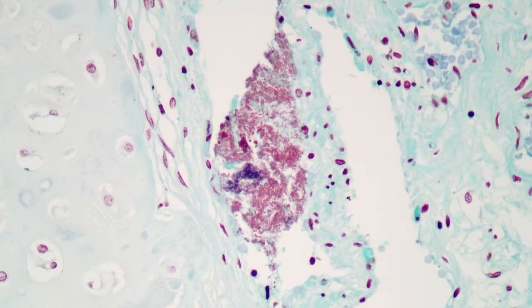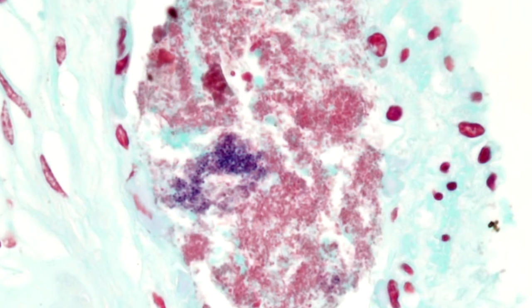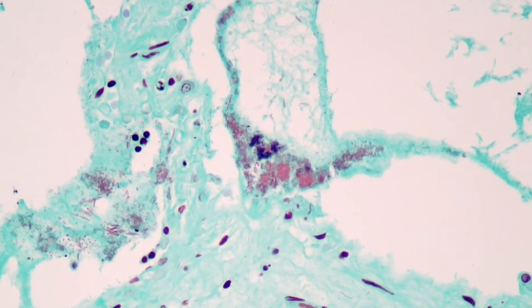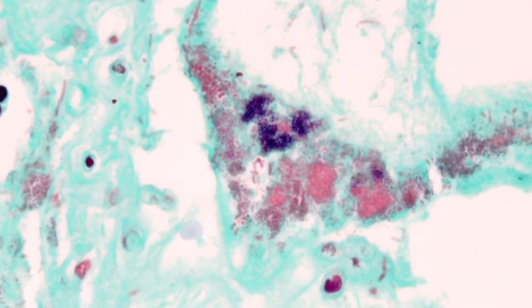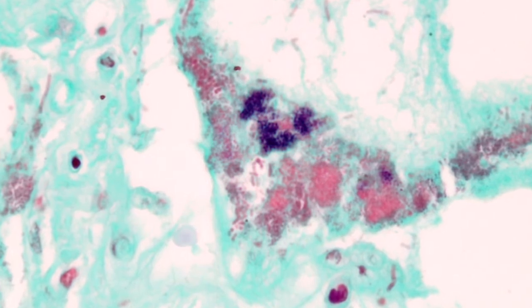Here are some results of the staining achieved on this occasion. There's an area of mainly round cocci-shaped organisms, with a definite blue area indicating the positive organisms stained with the crystal violet and iodine. Likewise there are some negative rods to the far left, and a cluster of positive blue and negative red organisms towards the centre. In terms of background staining, the neutral red is providing some background staining of cell nuclei, whereas the fast green is providing quite a pleasant background stain to the rest of the tissue section.